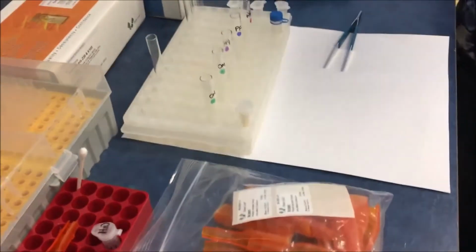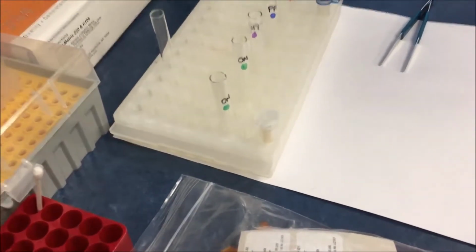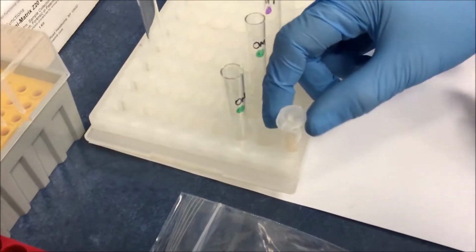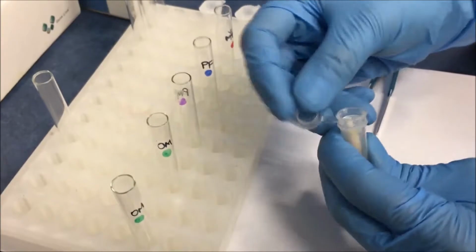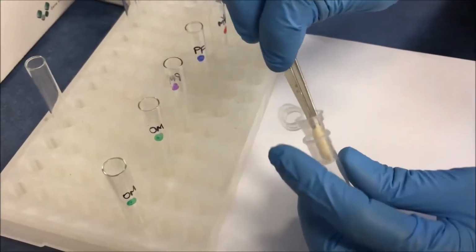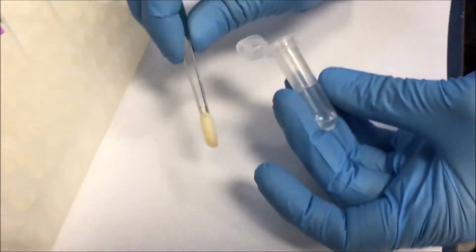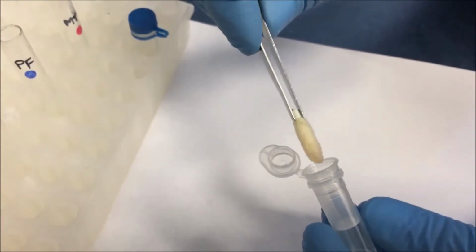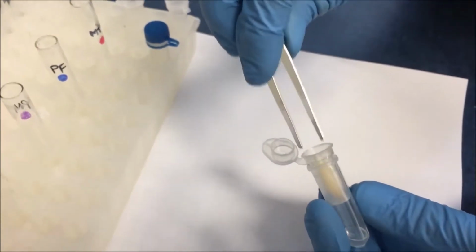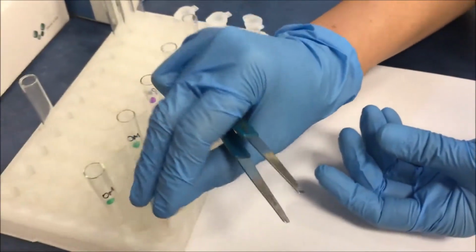It has been about 5 to 10 minutes that we allowed the Omni-Matrix and the swab to be soaked in the lysis buffer. In this case, we took the swab and actually centrifuged it also. Now we are going to take out the swab just to show you the color of the swab. If you see, it has already been spun and there is solution at the bottom of the tube as well. But in terms of the swab, there's still color. That color reflects sample retention, and that is what we initially said, that 20 to 80% of the sample is lost during absorption to the surface itself.